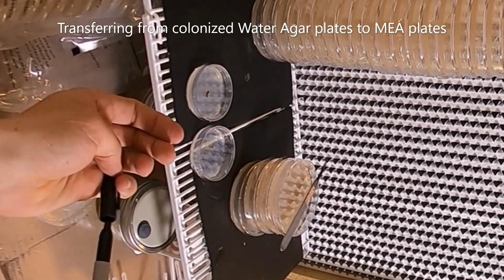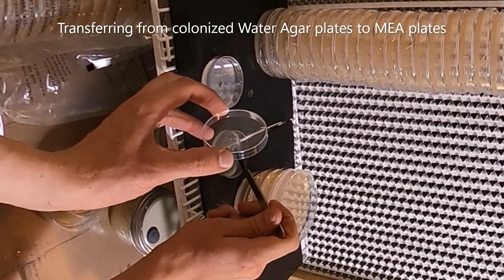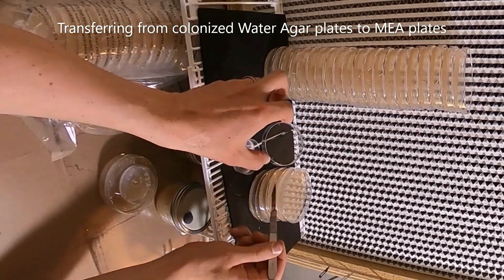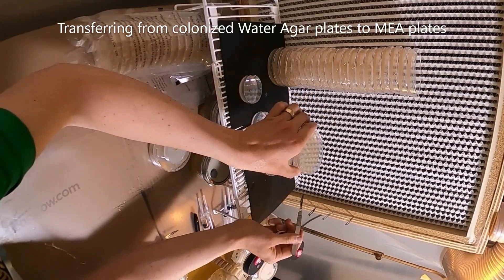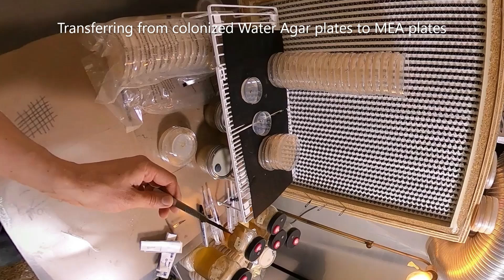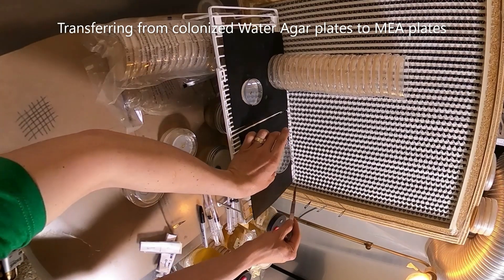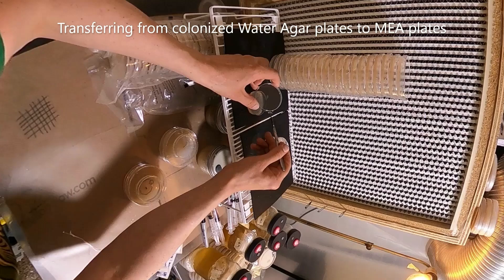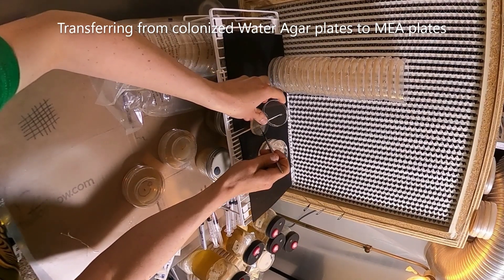Ideally I want the farthest edge of the mycelium, farthest away from any contamination. I just take a little hashtag-shaped sample, pull it out, and put it on a clean plate. I'm using the flow hood at this point because I'm not risking spores and bacteria blowing around, so I'm trying to do this as clean as possible. I'm taking two subcultures per plate. It's important to label your plates with the date and what sample you're doing so I can cross-reference if there were any problems with contamination — I can see whether there was an error in technique or if the sample was just contaminated.